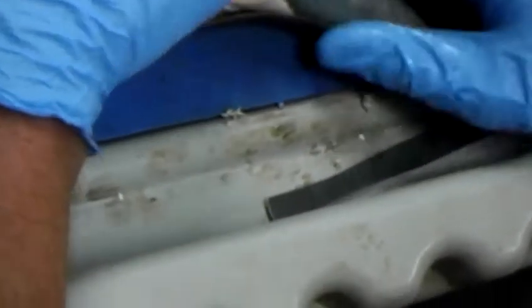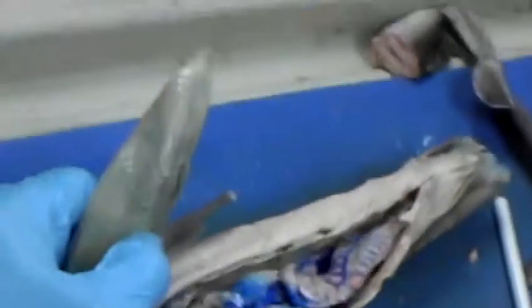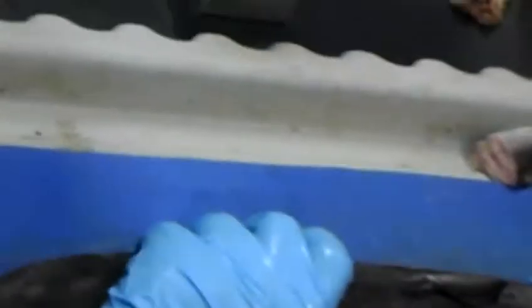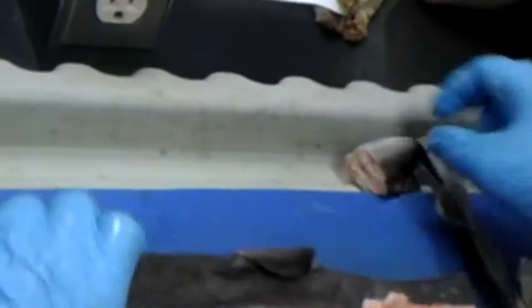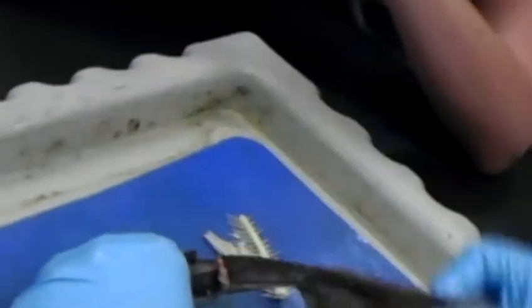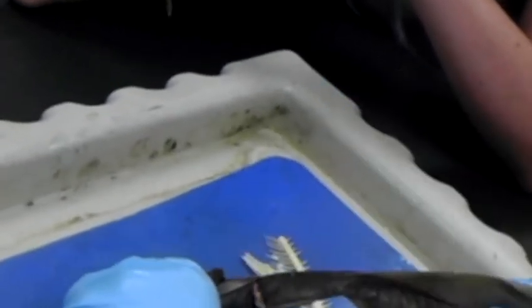Support structures of the digestive system. You recognize the big lobe, large structures as the liver. Liver is usually really big in the shark, and it helps them almost achieve neutral buoyancy. It's lacking a swim bladder, but it's pretty close with these guys. And why would you want neutral or close to neutral buoyancy? You don't have to exert that much energy going this direction. And that's what they think is the reason of the heterocercal caudal fin, is that when it hits, it's not only providing forward propulsion, it's also providing lift.